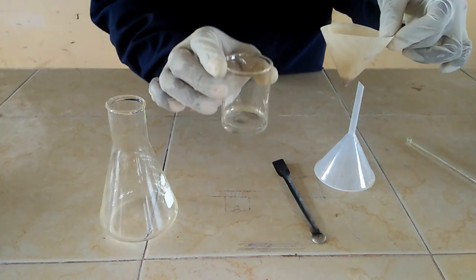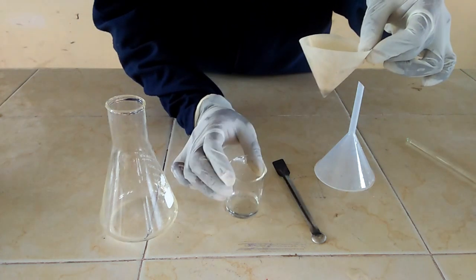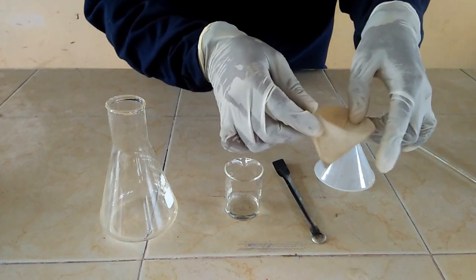So we have our water which we have filtered. This is our filtrate. You can see it is very clean.